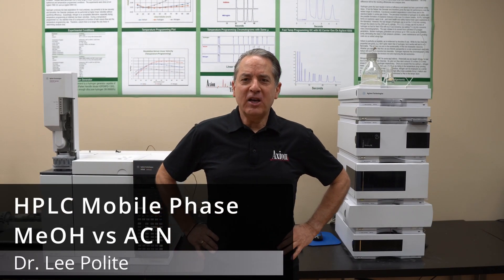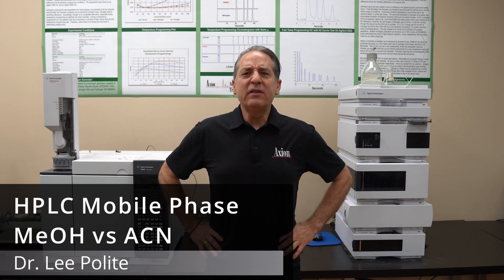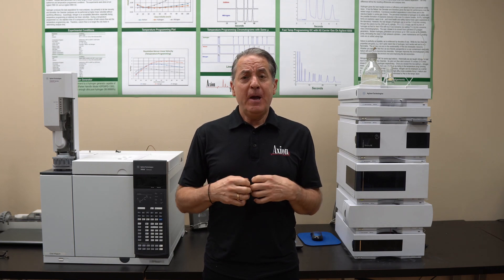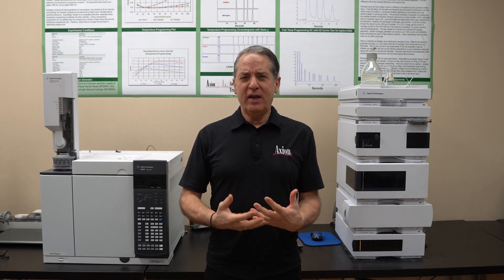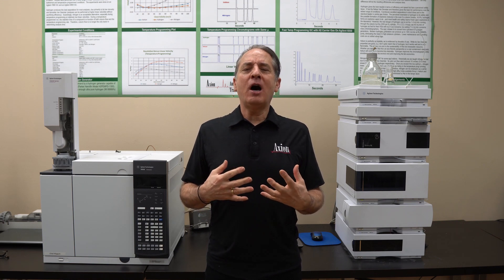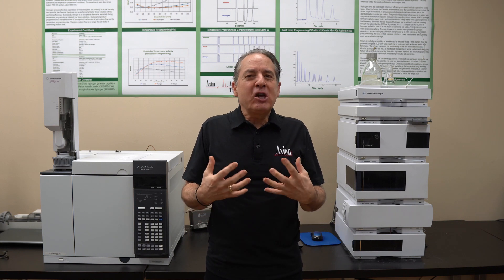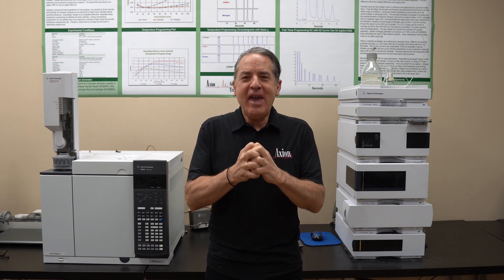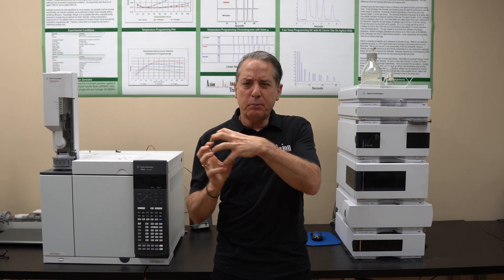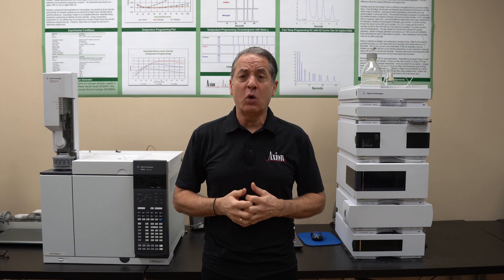Hi, it's Lee Polite from Axion Labs, and today I'm here to answer the question: what's the difference between methanol and acetonitrile? If you're doing HPLC, you need a mobile phase. The mobile phase plays a key role in the separation — its job is to dissolve the sample and carry it through the column. There's a competition for the analytes: the stationary phase tries to hold on to your molecule, while the mobile phase tries to pull it off the column.